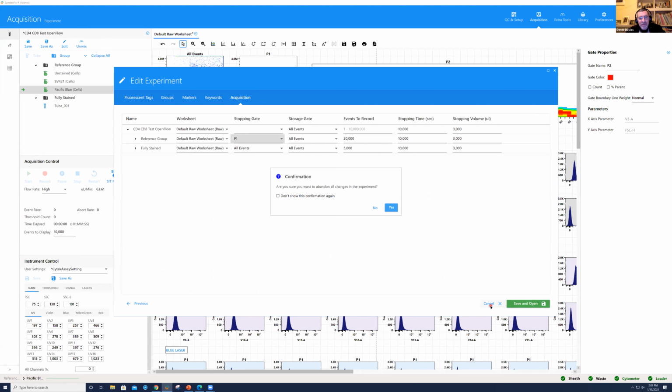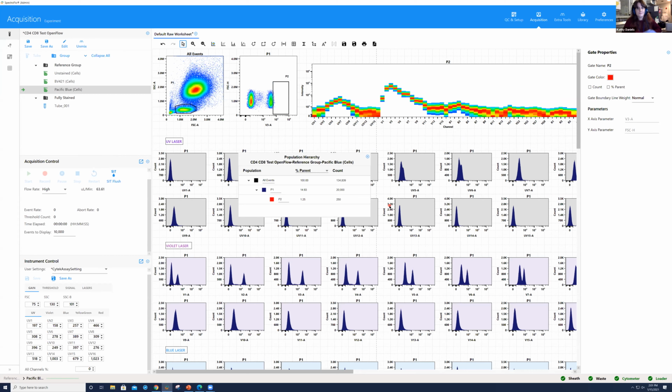Yeah, there's a comment actually about the number there in the Q&A, and that you should get an error message if it's too low, maybe below 200. Yeah, it won't let you do the unmixing if you don't have enough events. And there's one more question. I know we'll have to move on because I'm conscious of the time as well.